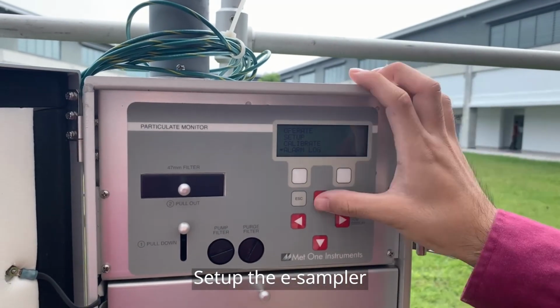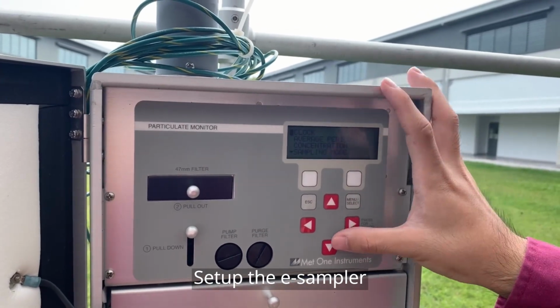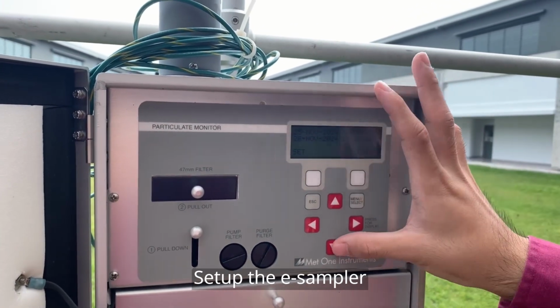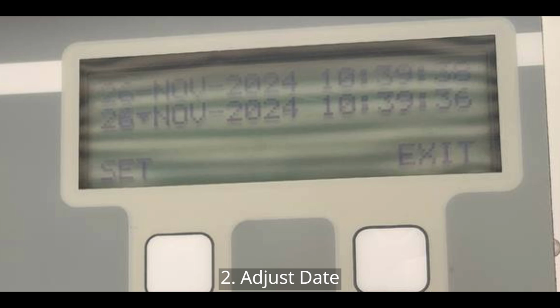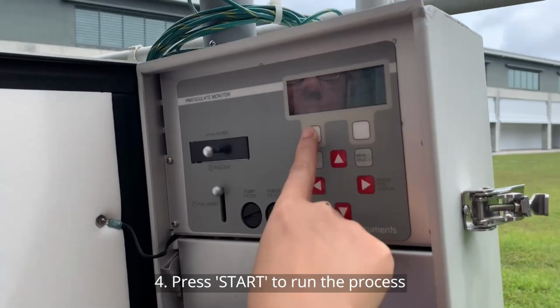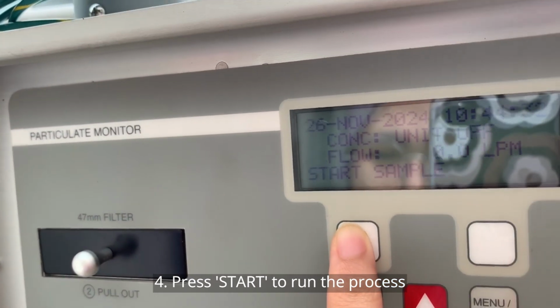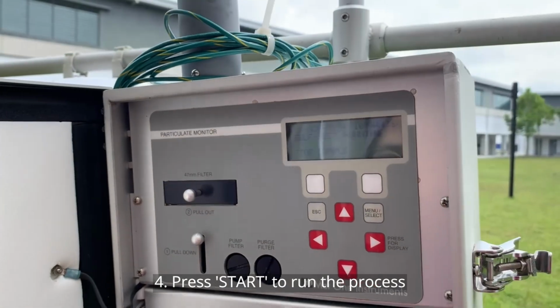Then continue to set up the information in the sampler device. First we set up the ID name of the station. Next, adjust the date and time of the experiment. And third, set the period time to 30 minutes. Lastly, run the e-sampler by pressing start. Make sure the e-sampler makes a sound to confirm that the device is already running.